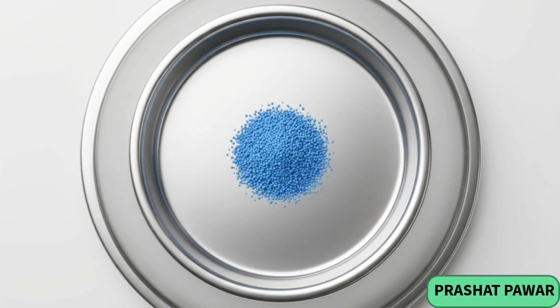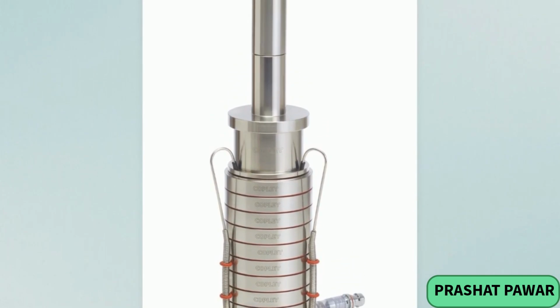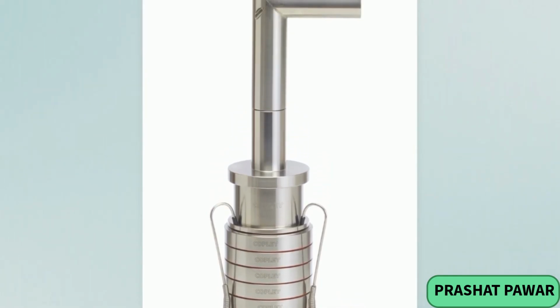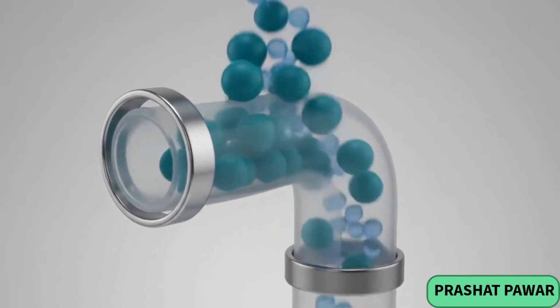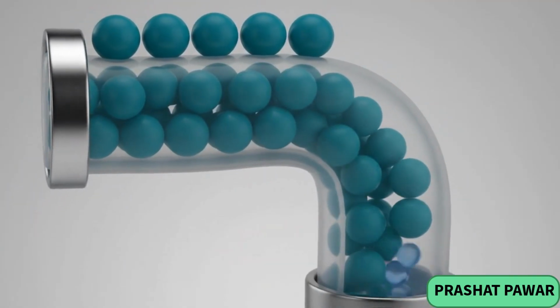To see the drug alone, we must physically capture its individual size fractions during flight. This requirement leads to cascade impaction. It provides the size-fractionated physical samples required to generate an aerodynamic particle size distribution exclusively for the active ingredient. The Cascade Impactor operates as a physical sorting mechanism, using controlled volumetric flow and particle inertia to categorize the dose.